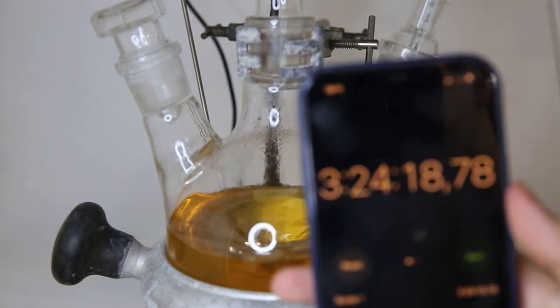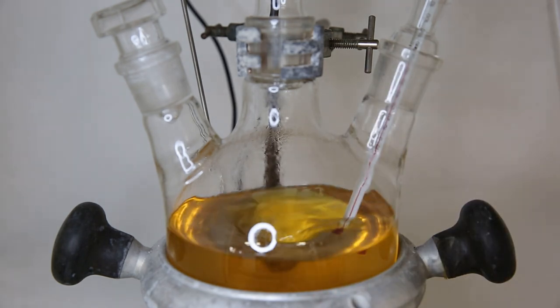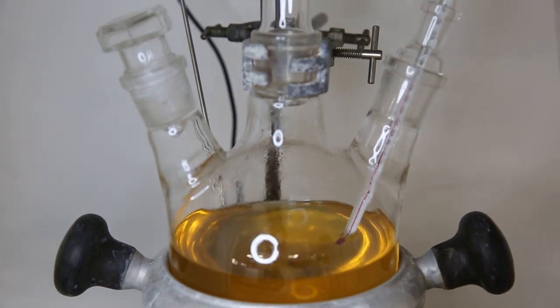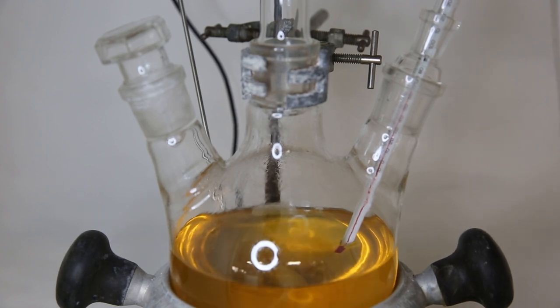So after about 3.5 hours, the reaction should be finished, so I remove the heat source. We can also see that the color has changed, which is a good sign that the reaction has taken place.